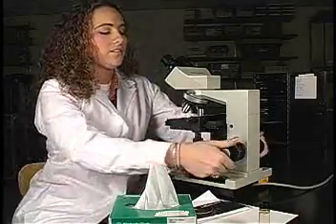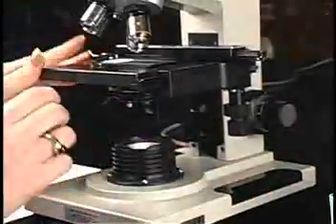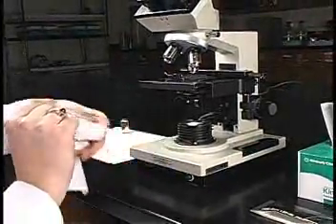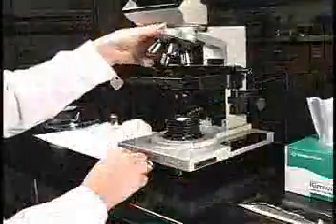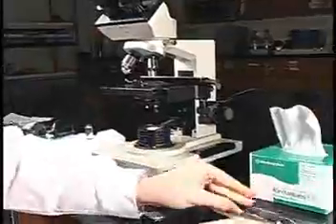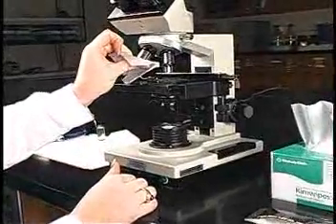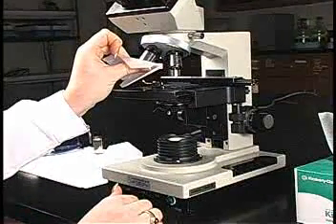After viewing the specimen, you're going to want to properly clean the lens and the slide. To clean the slide, you must lower your stage and remove the slide, then clean it with a kimwipe. To clean your objective, turn the objective so it's facing out and clean it with a piece of lens paper. You have now learned how to use the compound microscope properly and successfully. It's now time to shut down the microscope, but before doing so, there are a few things you need to do.